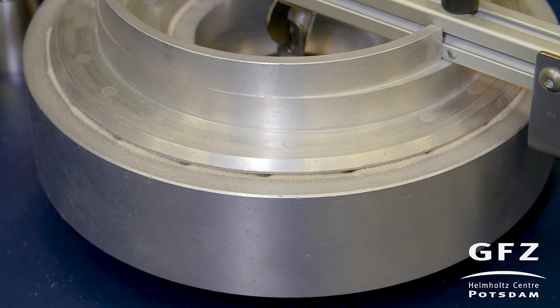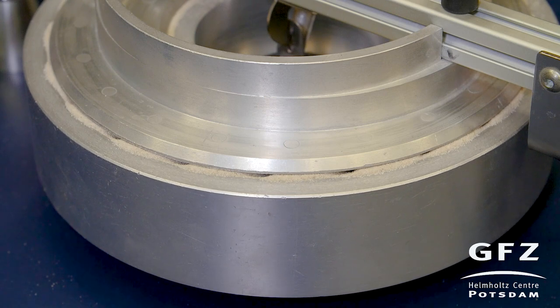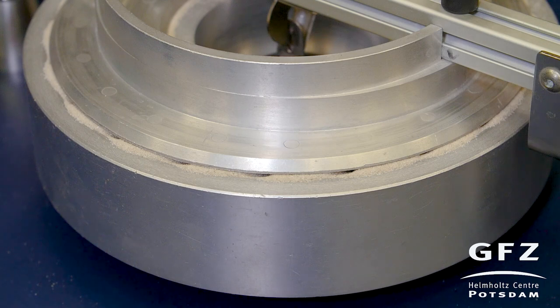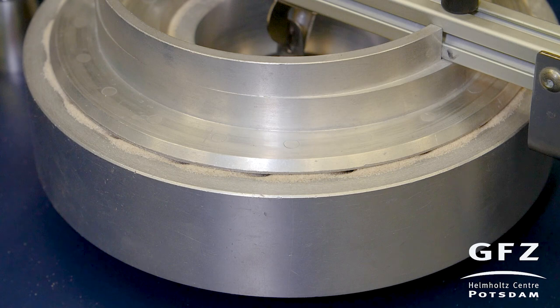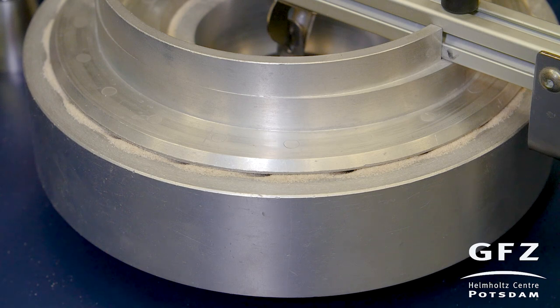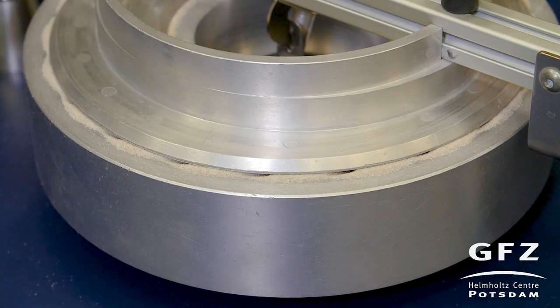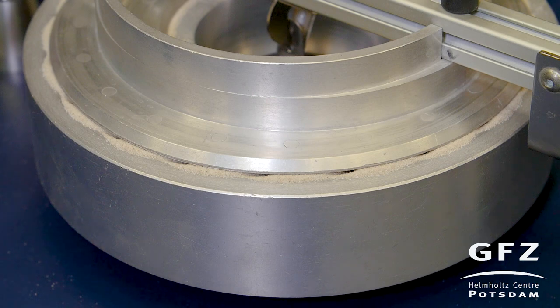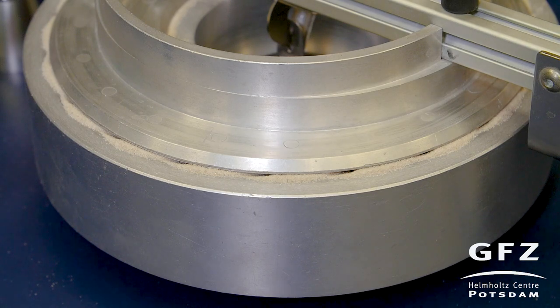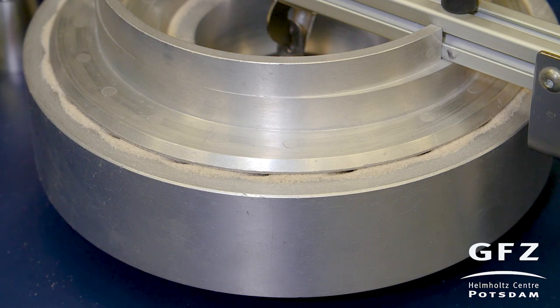Now we start seeing the shear zone forming. There is some material coming out of the shear cell, but this is accounted for by the software. Now we are in the first shear phase of the shear-hold-shear test. This shear phase is adapted in its duration based on the velocity — it's one over the velocity — so that each interval is exactly 3 millimeters. When the shear phase is over, the machine stops and waits for the hold interval. The first hold interval is 10 seconds, the next is 32 seconds, and the longest hold phase is 36,000 seconds, though this interval is only repeated once for timing reasons.